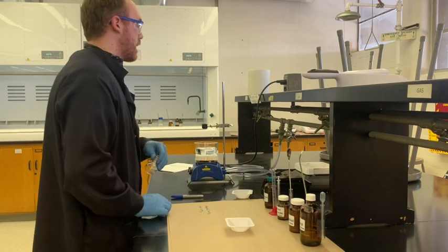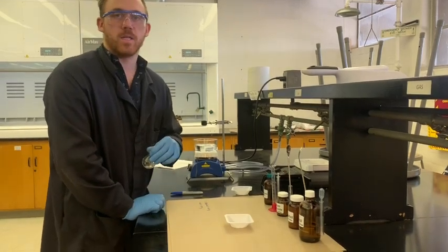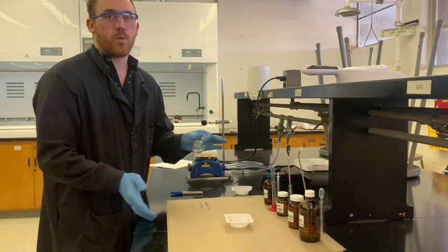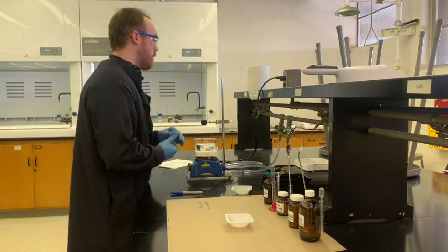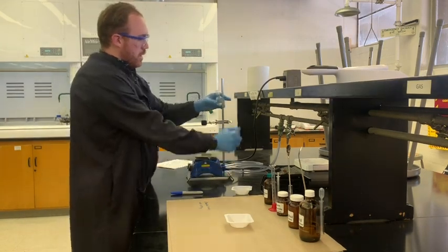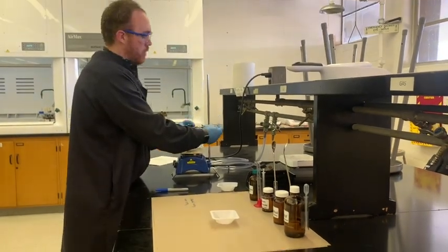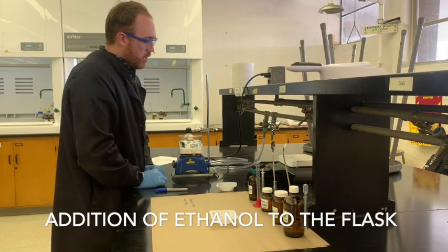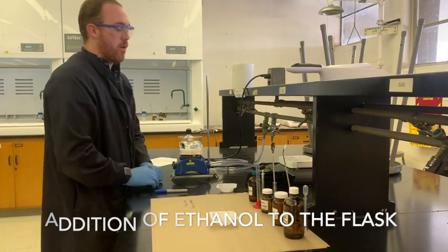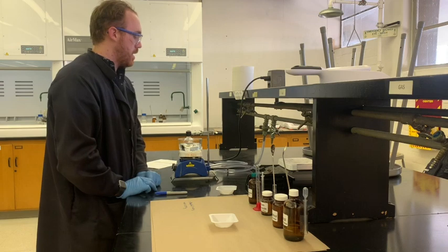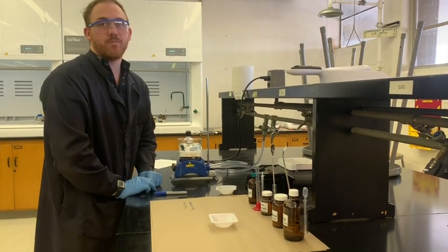Because the sodium hydroxide is going to get to work as soon as it enters the solution. It's going to dissolve pretty readily in just about anything. It's very soluble. Don't worry too much about how much solvent is in your flask. It doesn't really matter that much.